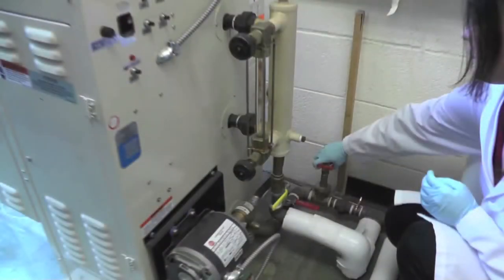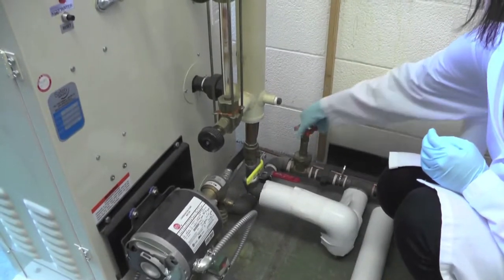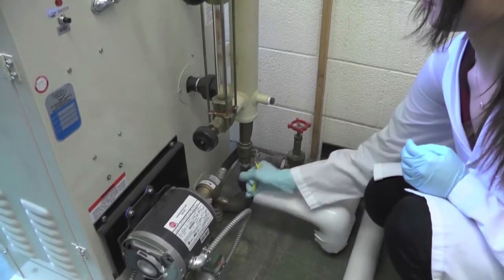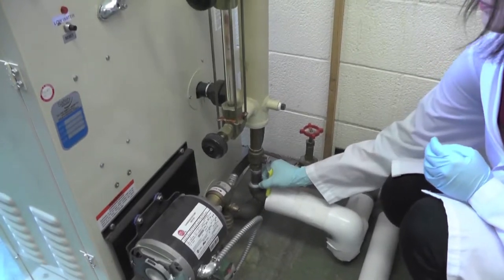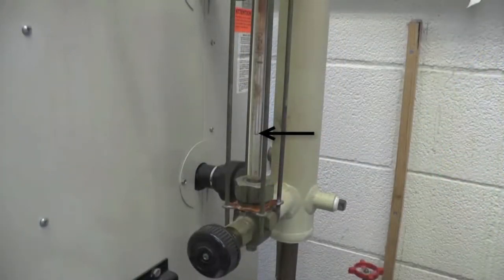To flush the steam boiler, first turn the red knob counterclockwise until loose, about five to seven turns. Then pull the yellow lever downwards. You should be able to hear water drain out and see a drop in the water level through the glass tube.